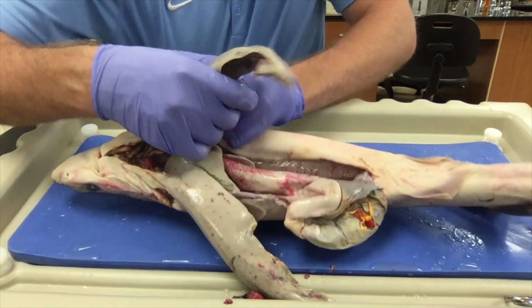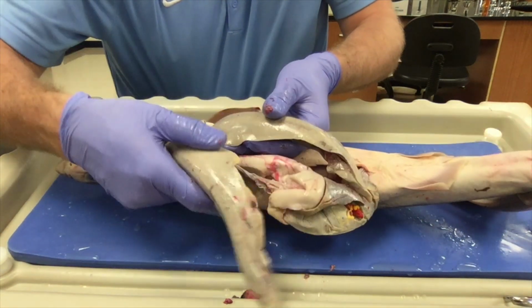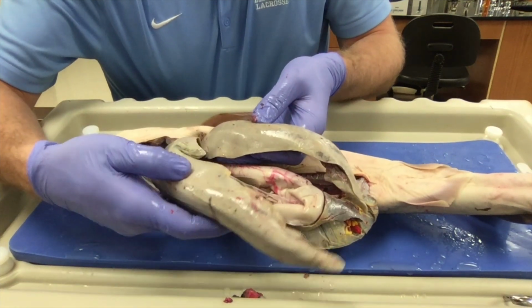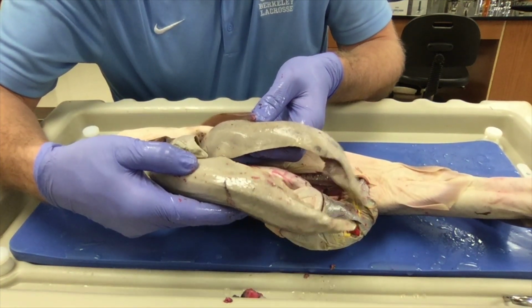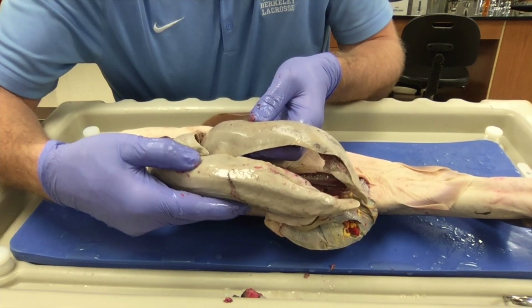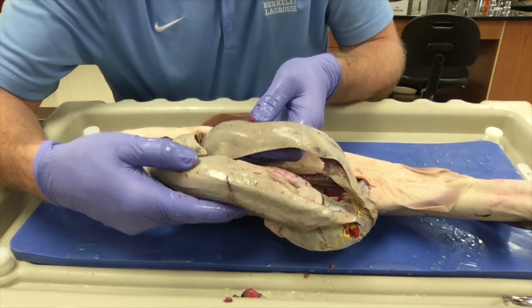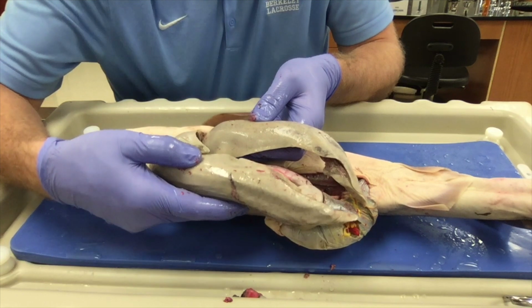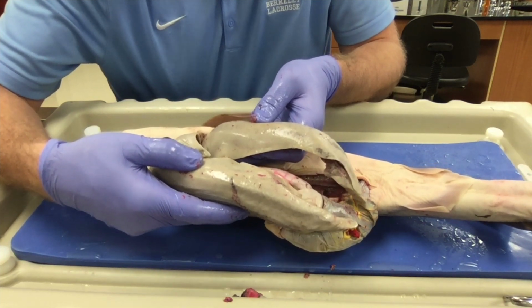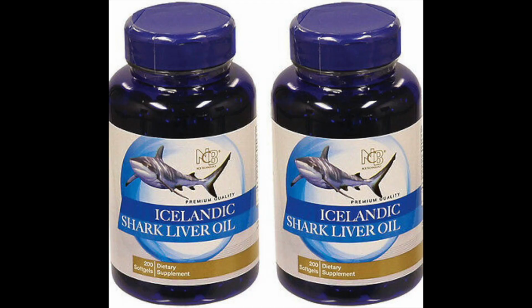Now you saw the bony fish, the perch's liver, used to filter blood primarily. The liver of that fish was pretty small. The shark's liver is so large because it lacks a swim bladder. Instead, sharks have very large livers filled with a special oil they create. This oil helps them to remain buoyant or floating in the water. If you've ever poured oil on top of something like water, it floats on top. Here are some shark liver oil pills you can buy on eBay for $36. They're used in traditional medicine.